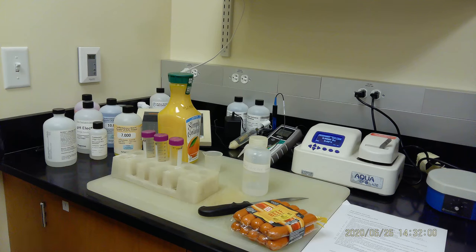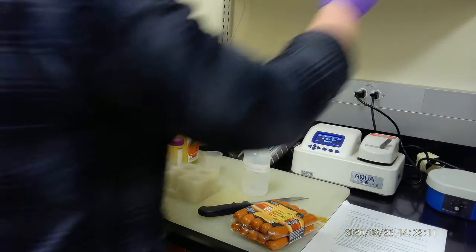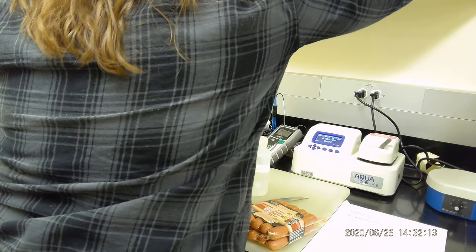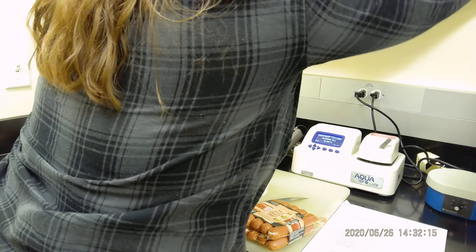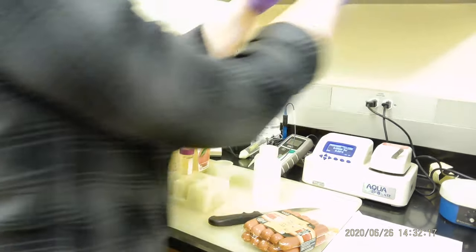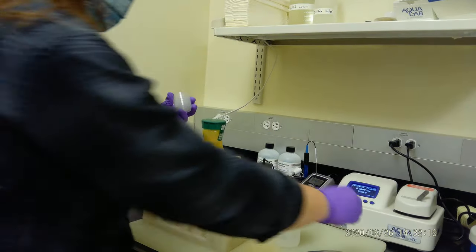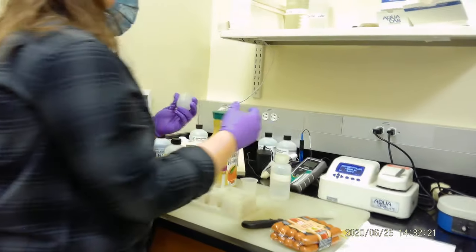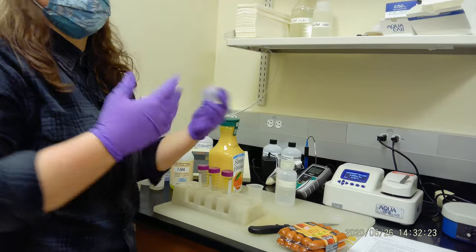We're going to do two—number one is juice, distilled water, and beef. So let's do a very simple one. Let's see the distilled water, what is the water activity. First things first, we have these little cups to measure water activity.